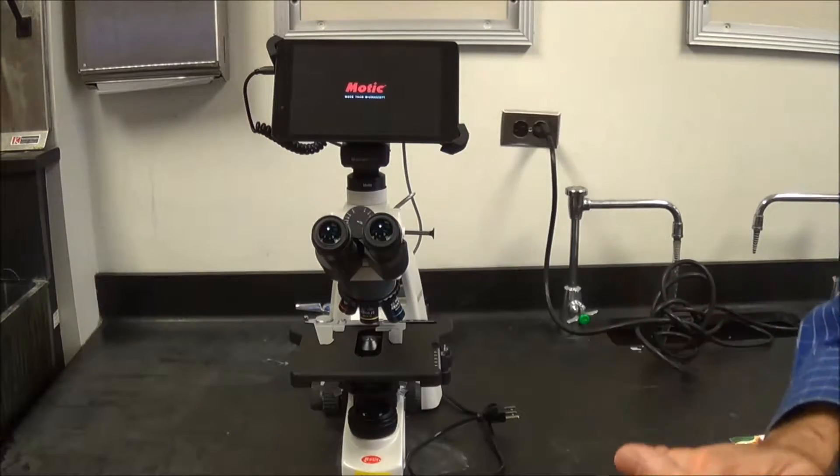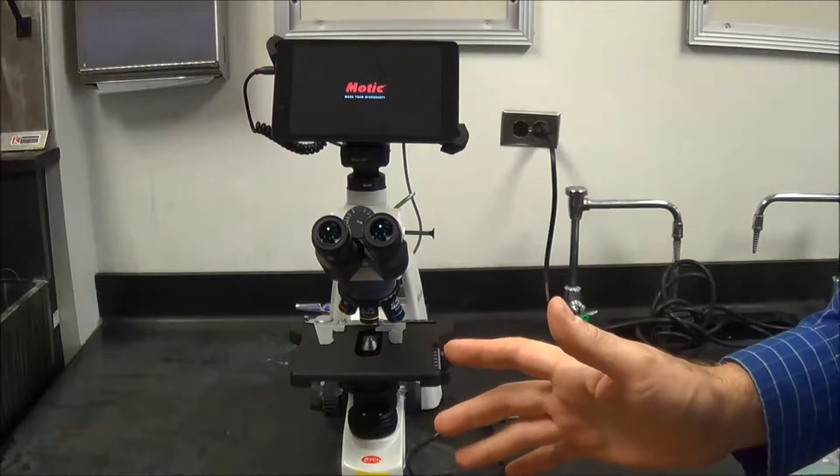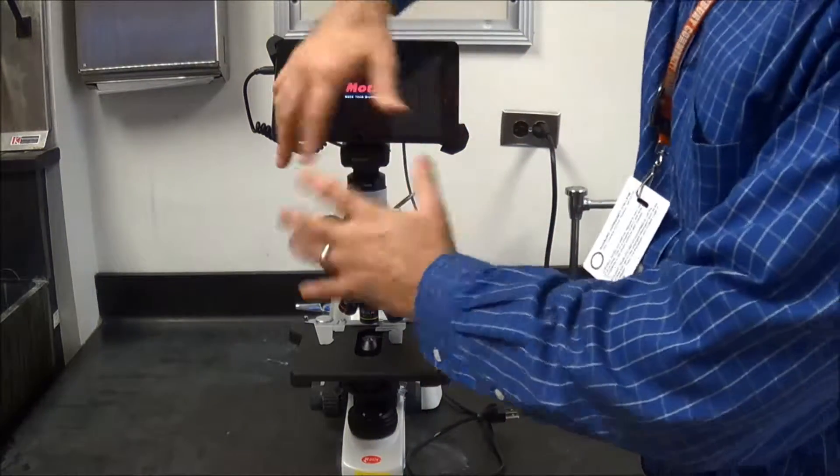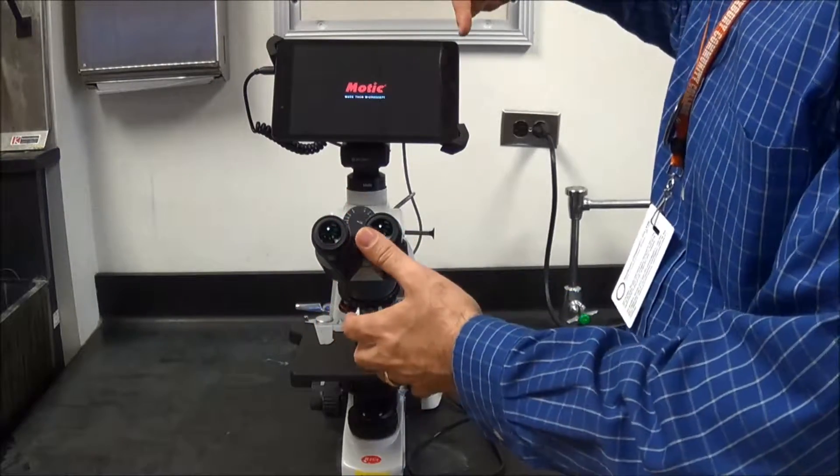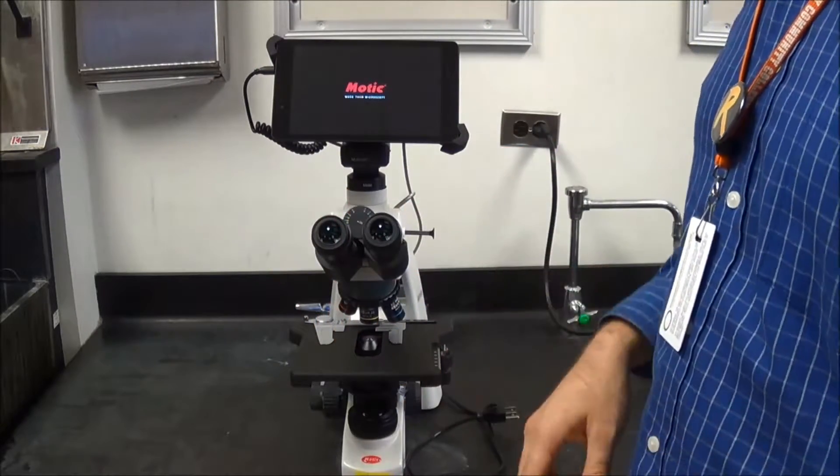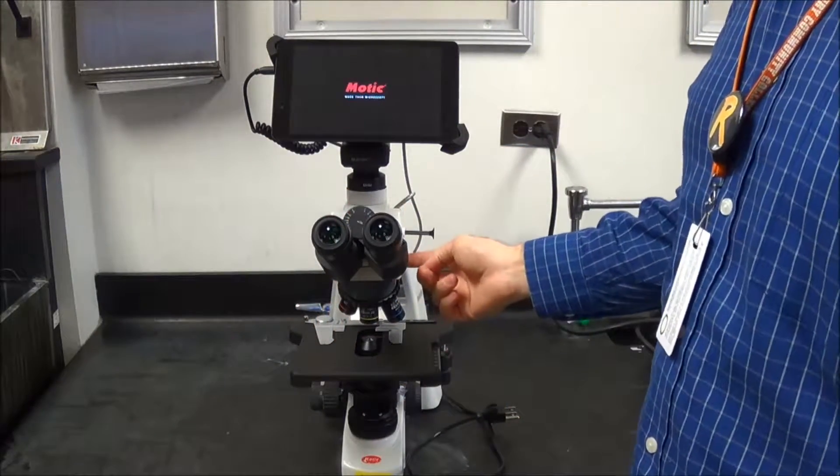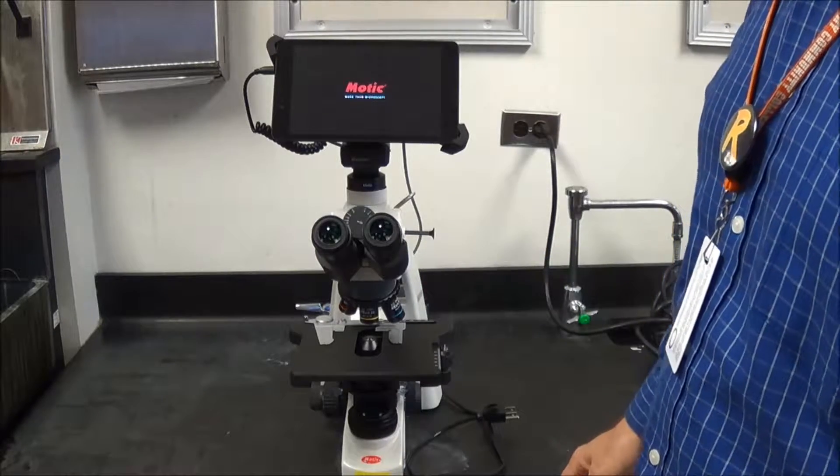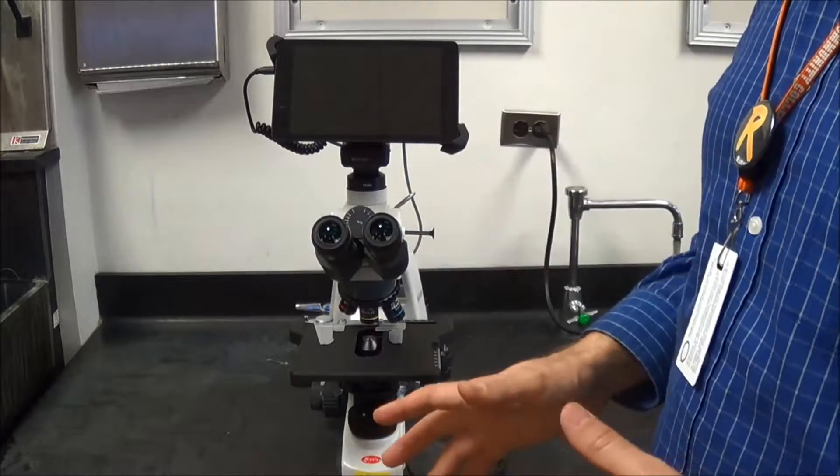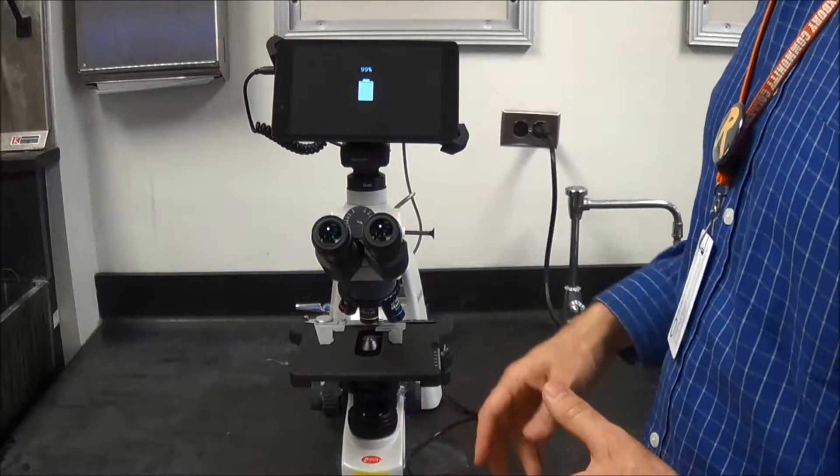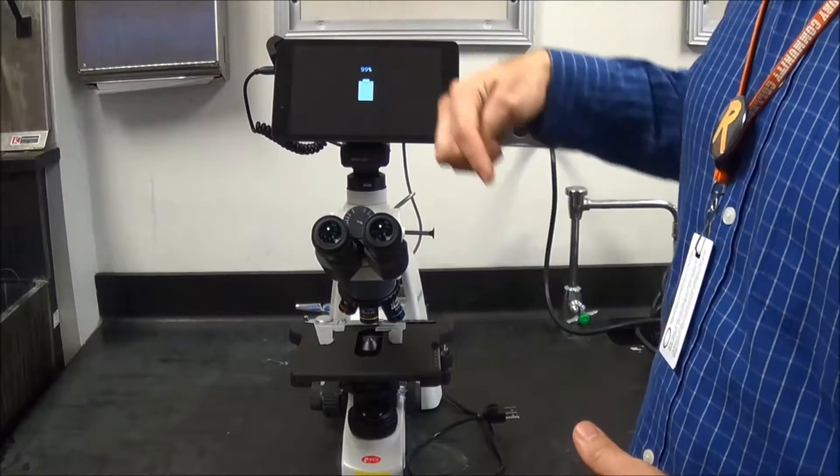In addition to that, unlike in the previous labs where we would always tell them to turn the head around, we don't want to do that. We've actually removed the thumb screws on most of the microscopes so that it cannot be done. But in case yours still has a thumb screw, do not have your students turn the heads around.